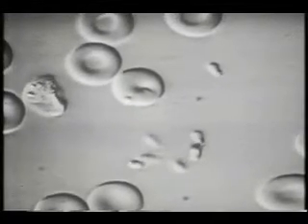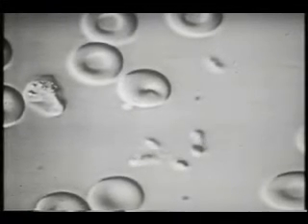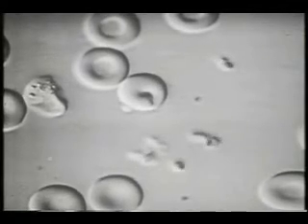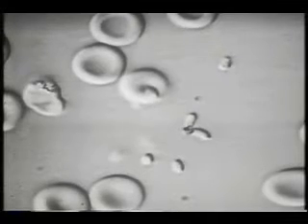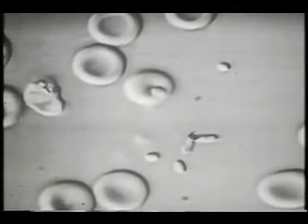The movement of Merozoites is caused by several external forces, such as Brownian motion. In addition, Merozoites have intrinsic motility. These two Merozoites have settled on the glass surface and propel themselves along this surface.